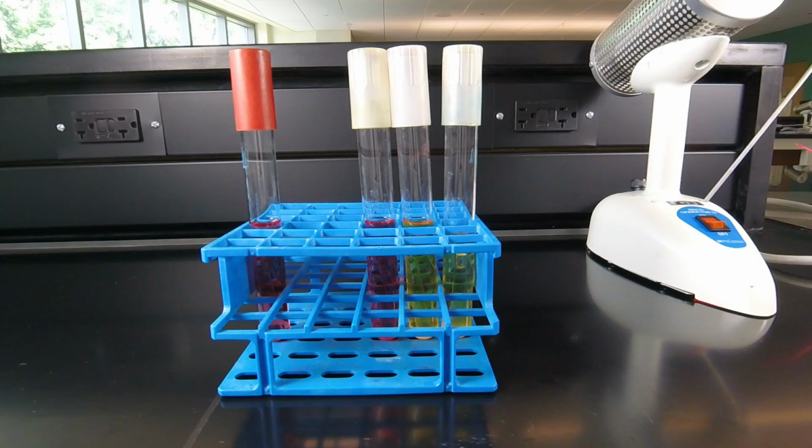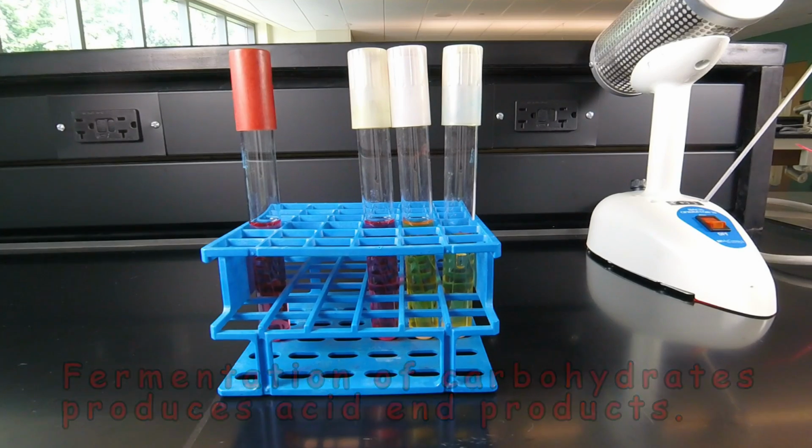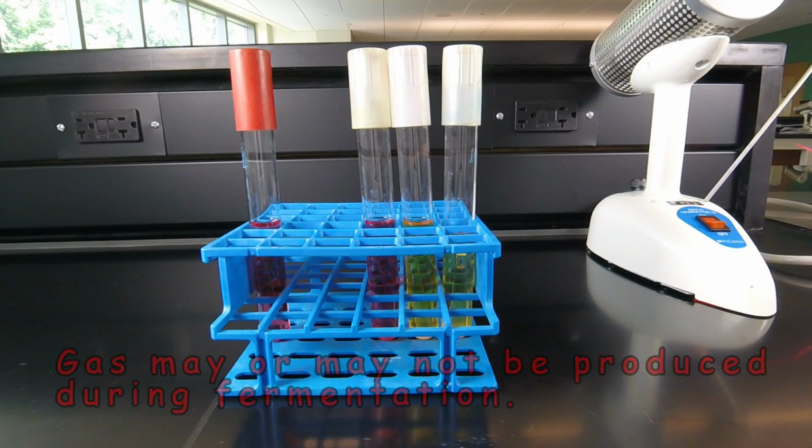And the medium contains one specific carbohydrate, in this case either maltose or lactose. Now there are a couple of possible end products of fermentation. When bacteria ferment sugars, they produce acid end products, and the acid in turn can lower the pH and turn the Phenol Red pH indicator from its red color at a neutral pH to a yellow to clear color as acid is produced. If gas is also produced during fermentation, that appears as a large bubble in the Durham tube or gas tube that's inside the broth tube.